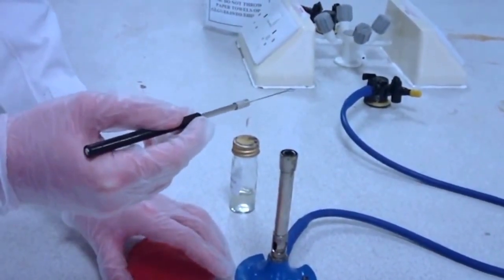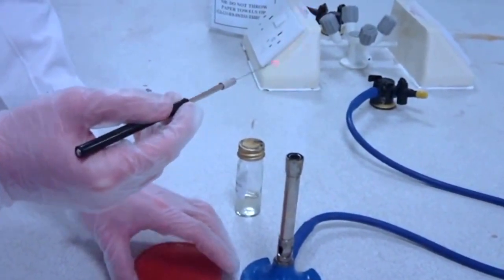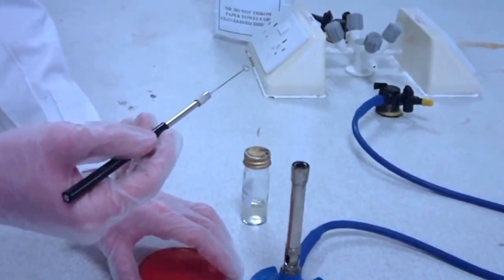Reflame the loop and then repeat the streaking process towards your next dot.